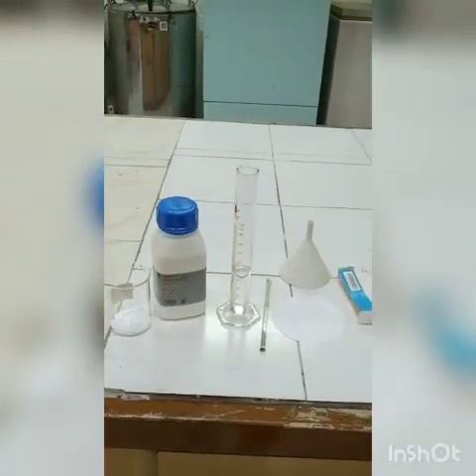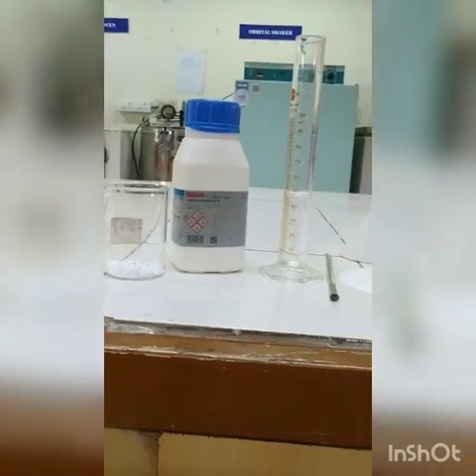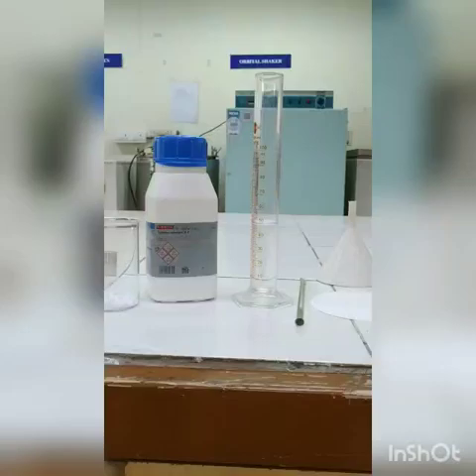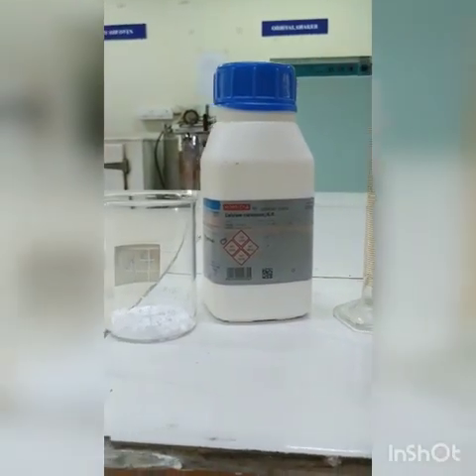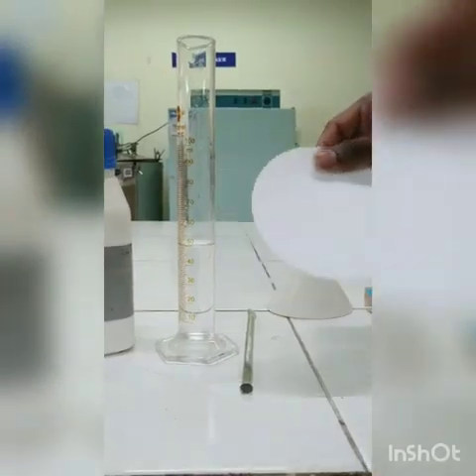We are going to see about the batch filtration method. For that, first we need to look into the requirements for this experiment. We are going to use calcium carbonate as a filtering material, okay? And we are going to use the filter paper as the filter medium.